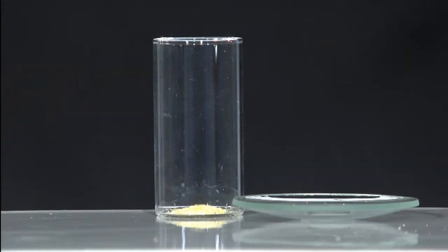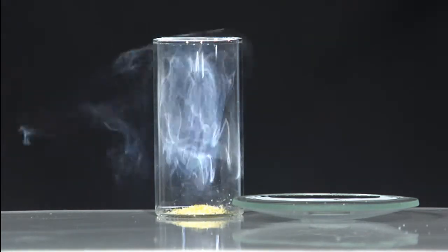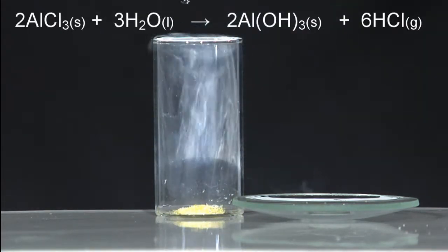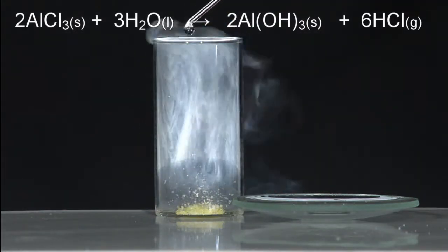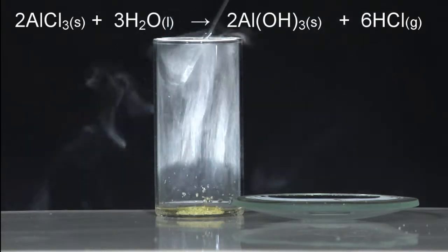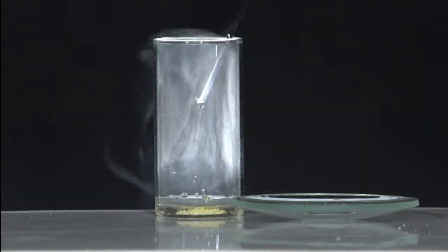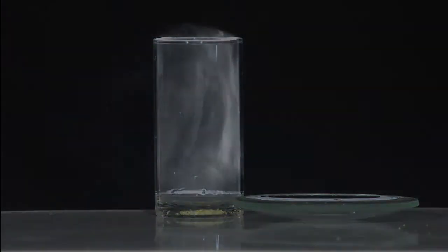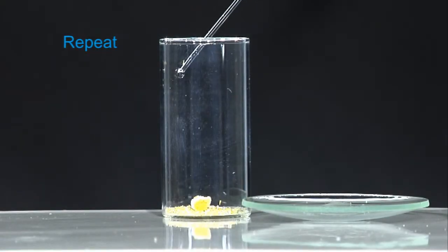In this test, a few drops of water are added to some solid aluminium chloride.